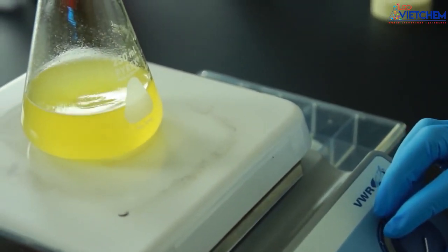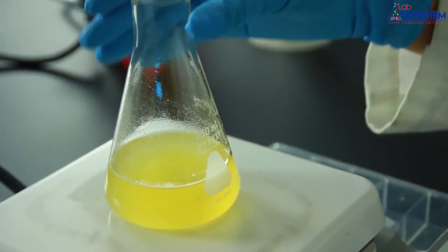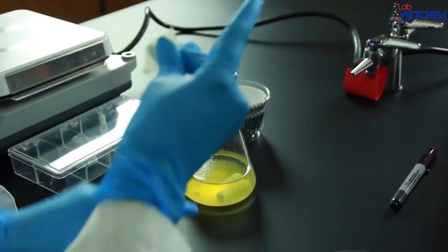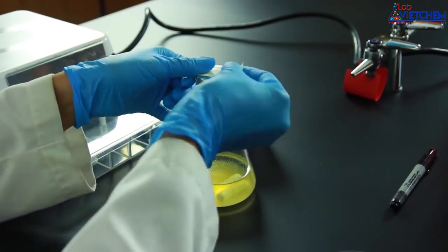We need to sterilize this flask containing an agar bacterial media. Cover the top with foil and place a piece of autoclave tape over the foil.